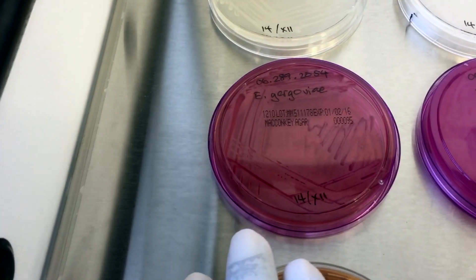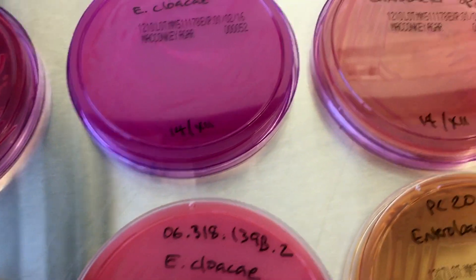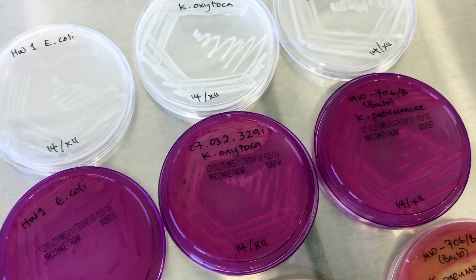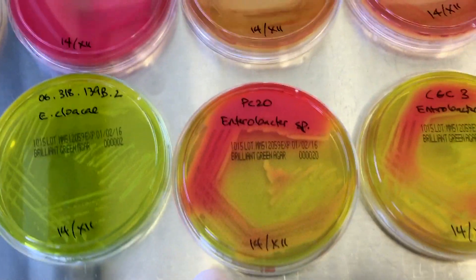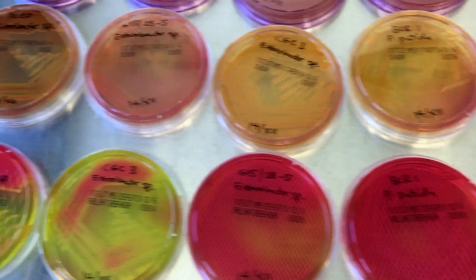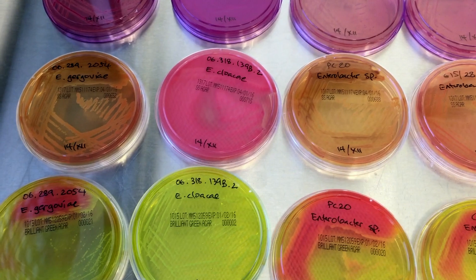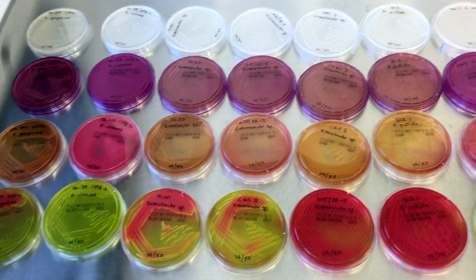On MacConkey, you can see there's not a lot of distinction except the coloration of the medium and the feeding on — it's not as evident as the brilliant green. This is after 24 hours of streaking and incubation at 30 degrees Celsius. These Agars will now be put into 12 degrees storage, awaiting my supervisor's advice on the next direction that I might take.